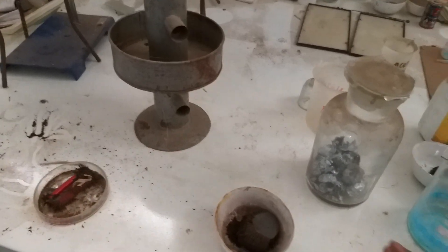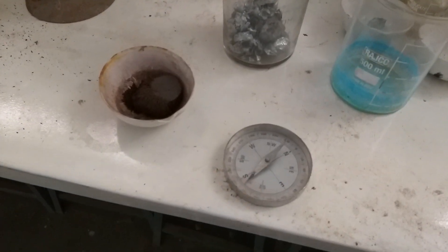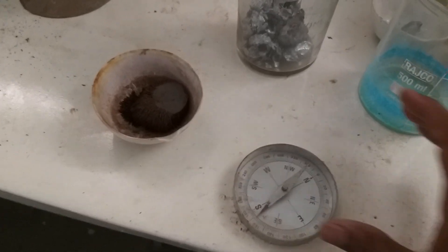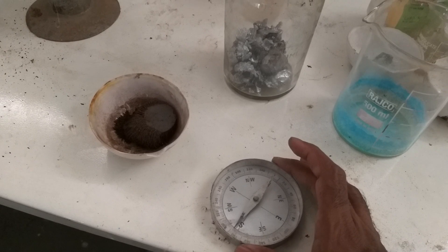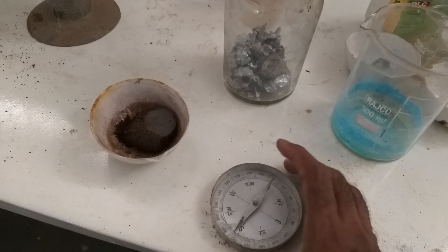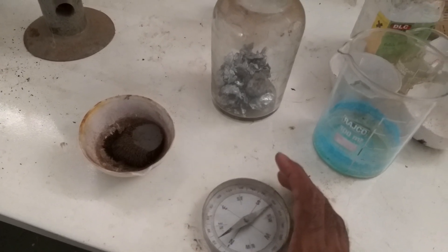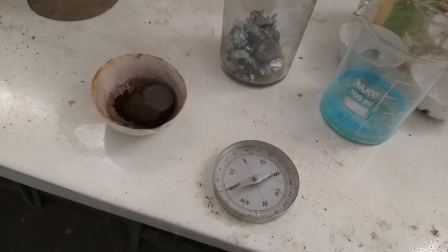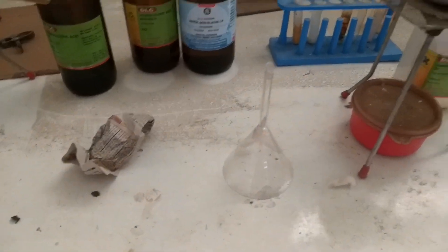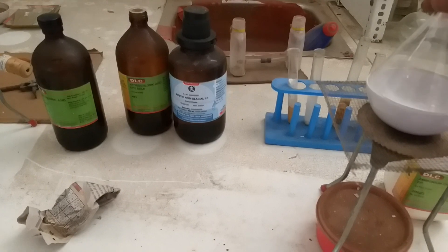We know the characteristic of a magnet: it is stable in the north-south direction. You can change its position but it still points constantly north and south. This is a glass funnel and this is a total assembly for the sublimation process.